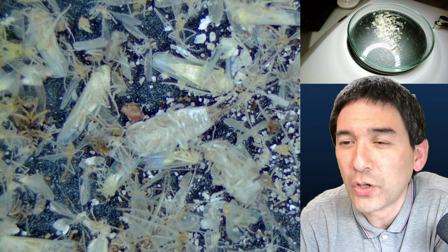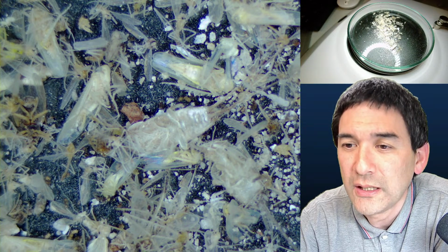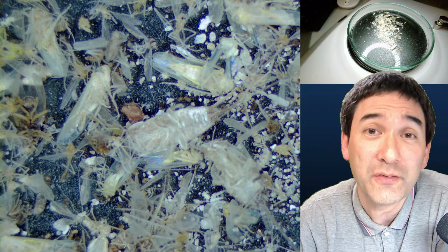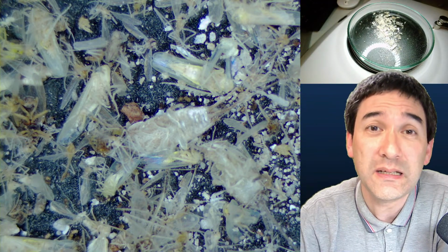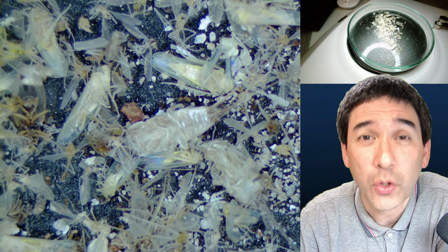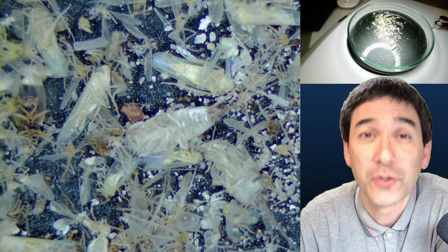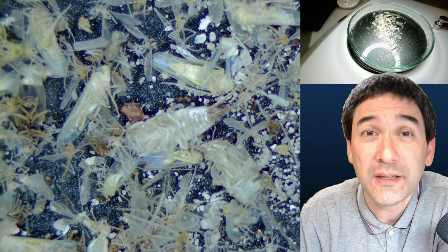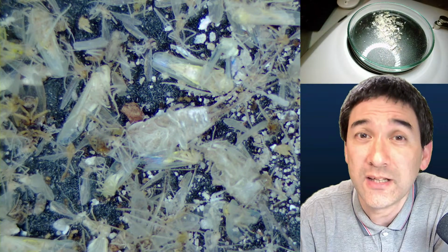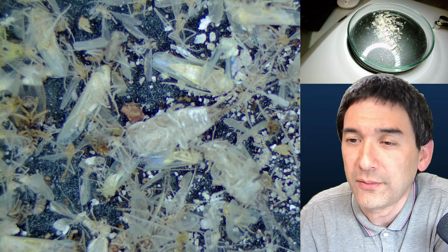Is there any way to soften the insect a little to make the entire preparation? Every time I try to assemble the object, it gets crushed and loses its shape. Insects, indeed, also because they have a certain thickness, can become damaged. Generally, one way of softening it is first rehydrating it with water, and then adding some base like sodium hydroxide or potassium hydroxide, and this really softens the exoskeleton a lot. You leave it in there for a few days.